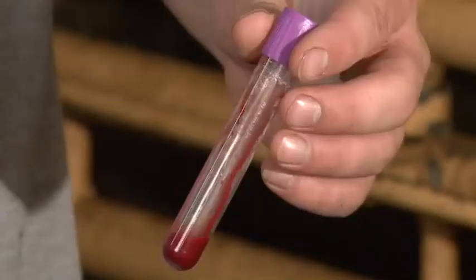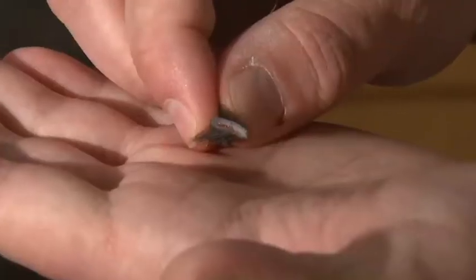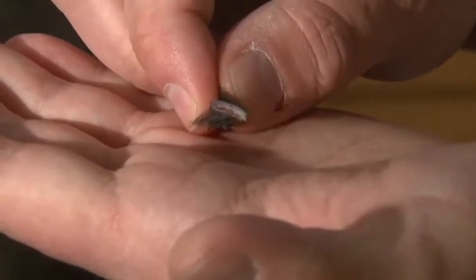In closing, the three types of DNA samples demonstrated today were: a hair sample from the switch of the tail; two different methods of taking blood from the tail — one onto a collection card and the other stored in a tube; and a tissue sample in the form of a notch from the animal's ear. When taking DNA samples, it's critical to communicate with the lab you're working with, let them know what test you want run, and they can advise you on the best sample to send. Ensure samples are clearly identified with the animal's ear tag number and are clean and free of debris such as manure, dirt, or another animal's tissue or blood. When taking blood samples, use a different needle and syringe for every animal.